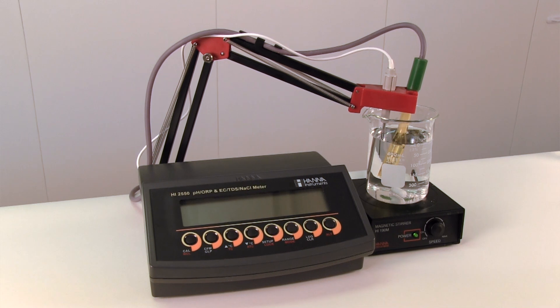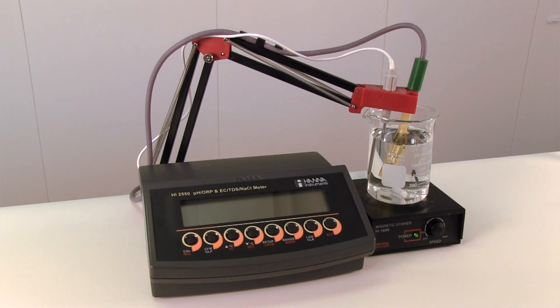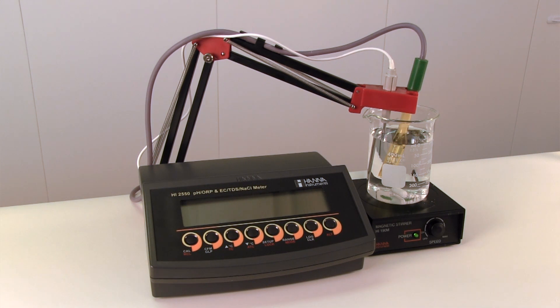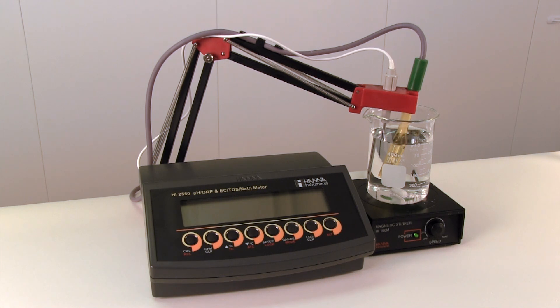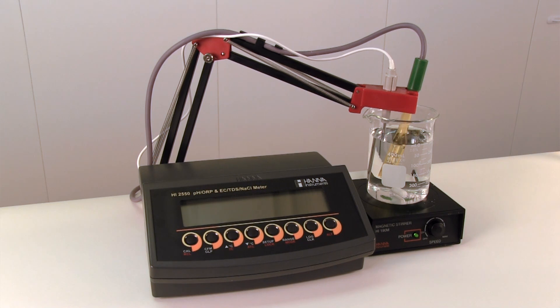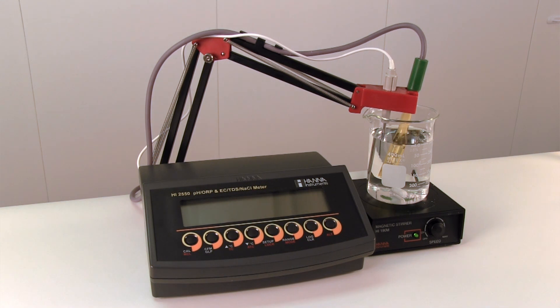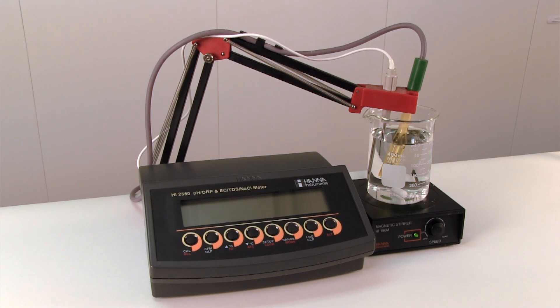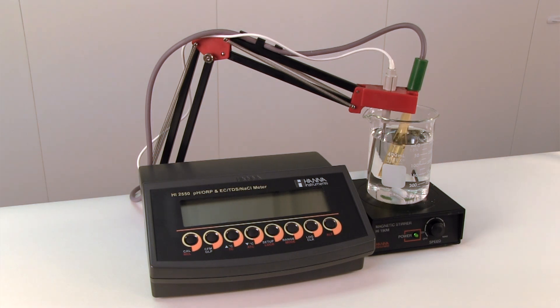To aid in my demonstration, I will be using the Hanna Instruments HI2550 benchtop meter. This meter has automatic and manual temperature compensation, as well as the ability to auto-range from zero to 500 millisiemens per centimeter.